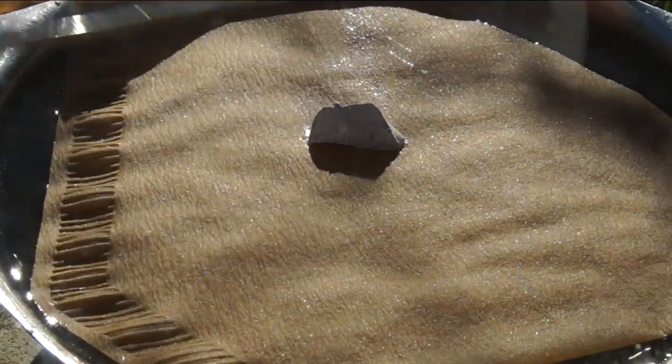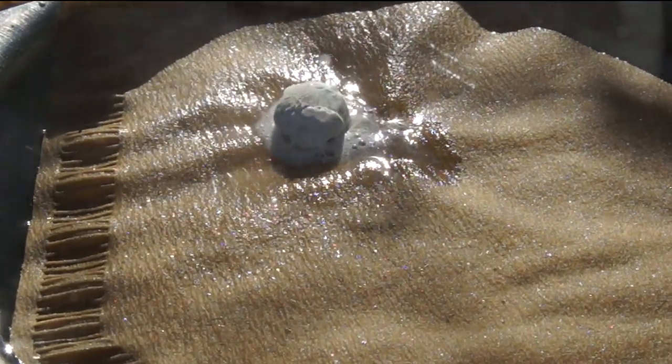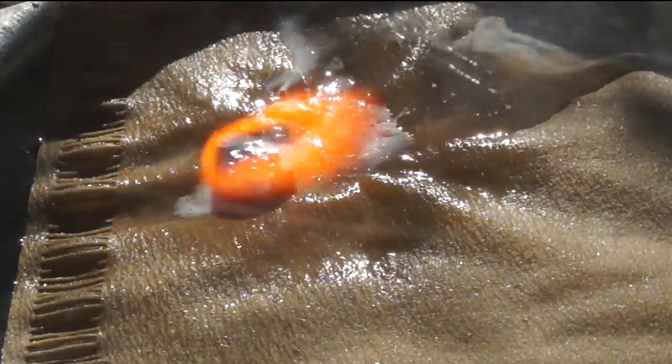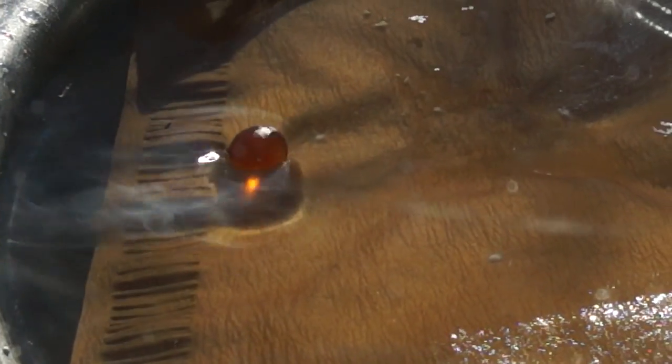I did this experiment several times and every time the same result was achieved. First, the droplet of sodium ignites, then the burning stops, and then for a reason unknown to me, a droplet of unknown substance was formed which was floating on the surface of water.